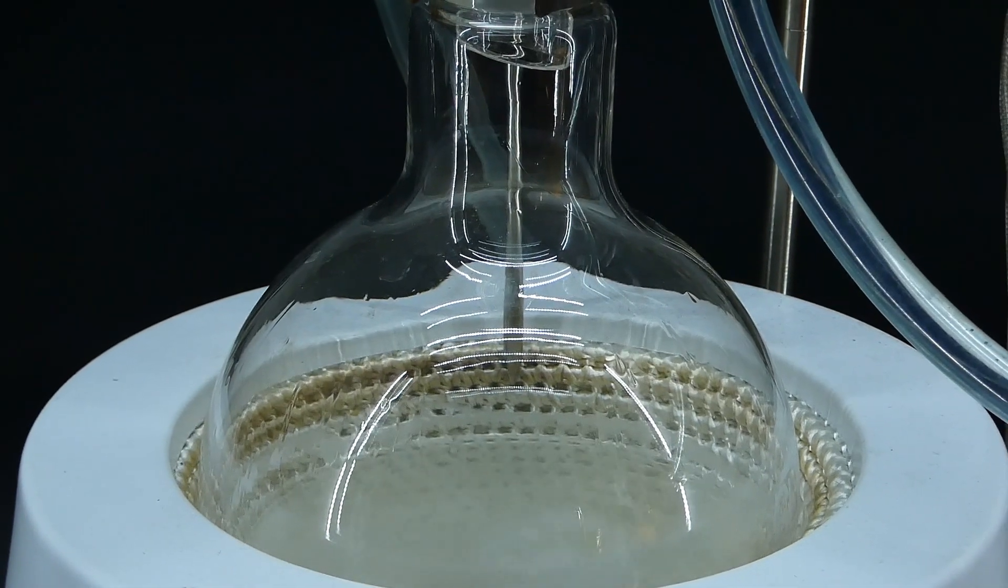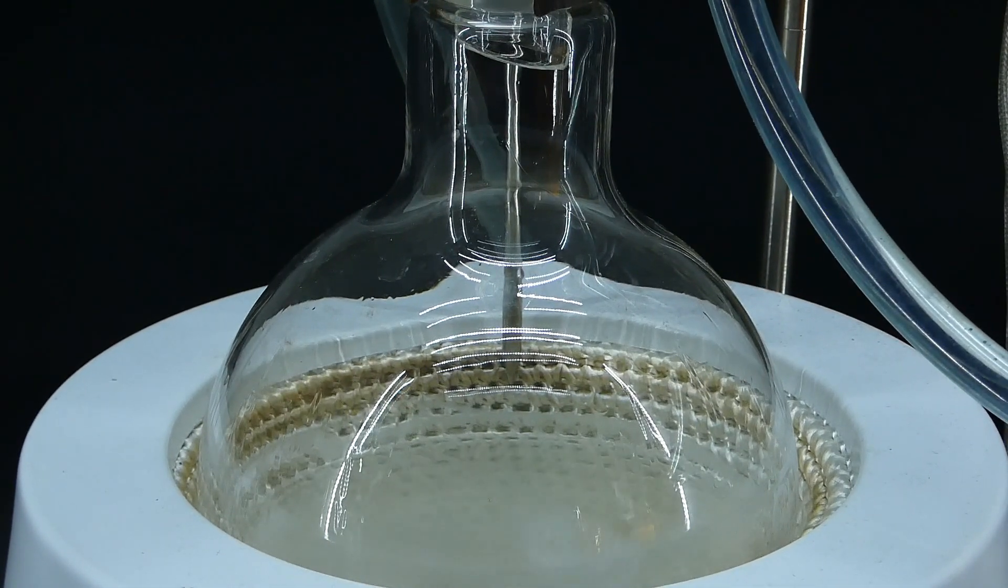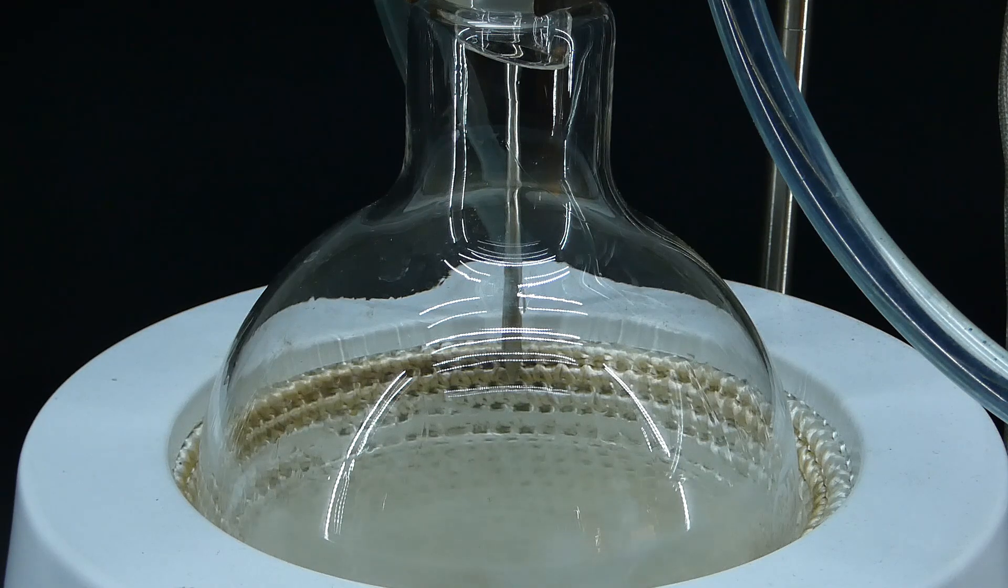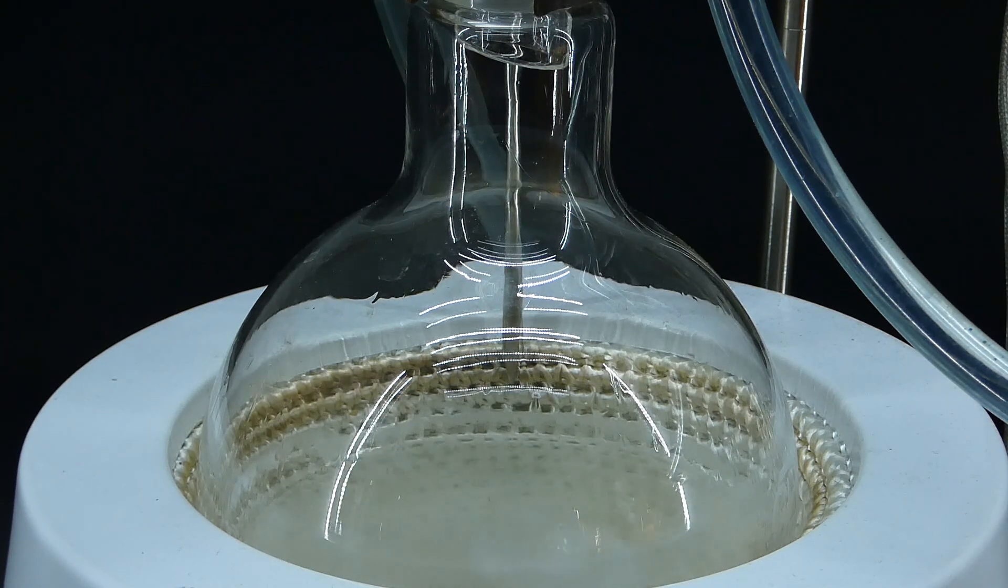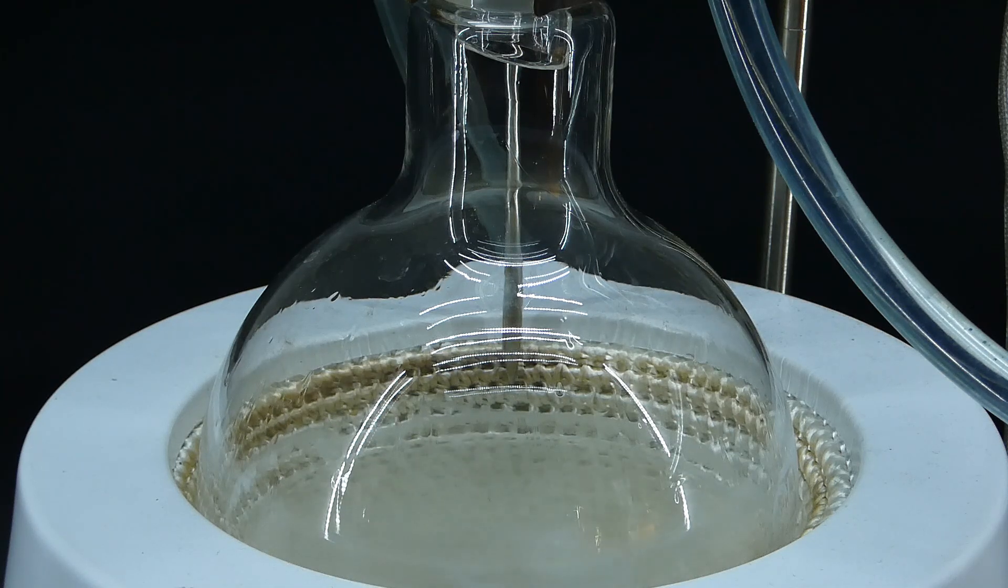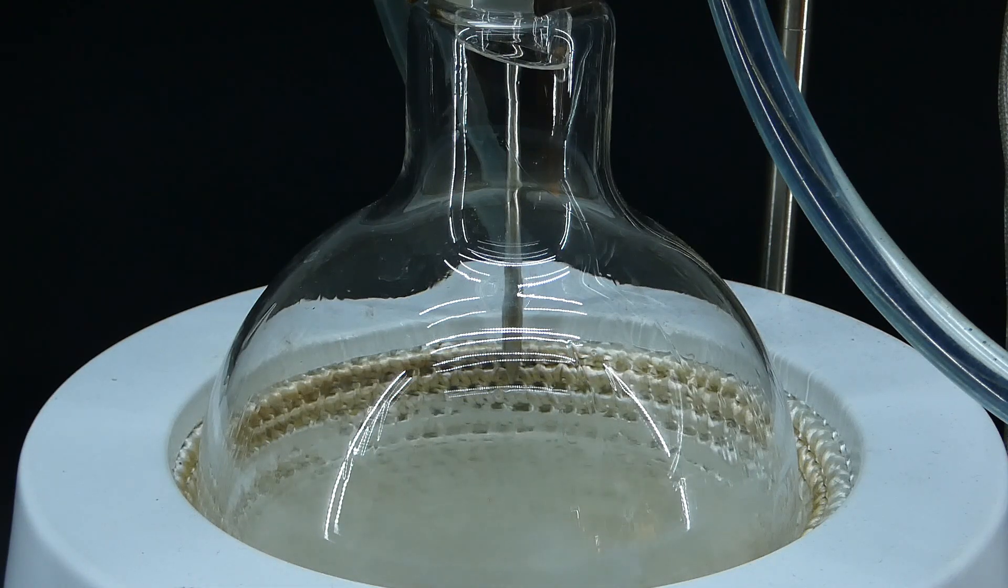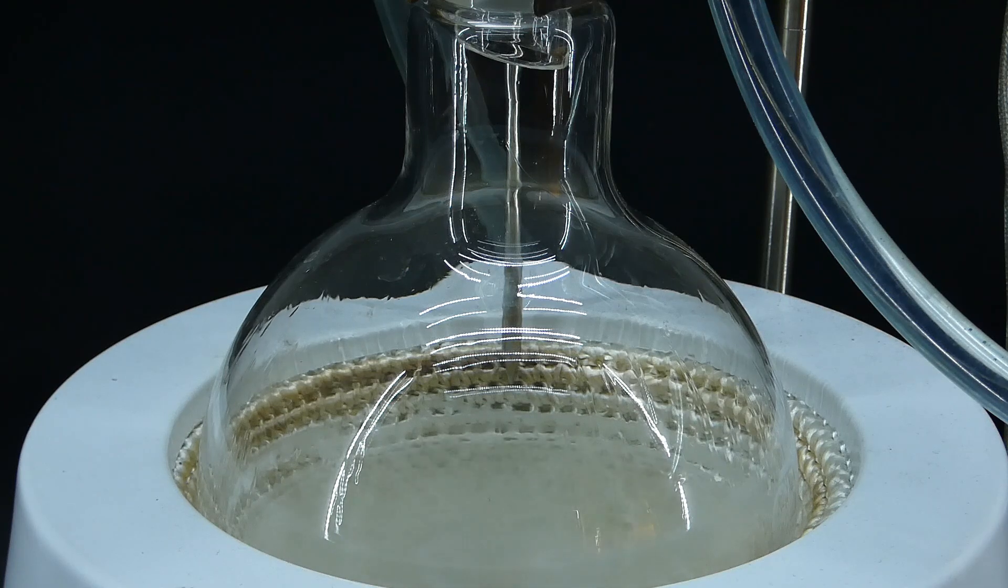What I am doing here is just refluxing the mixture, because the reaction takes some time to complete and requires elevated temperatures at which the methanol boils, so it needs to be condensed to avoid loss. Some of it escapes nonetheless, and that is why I added more. So now that this is refluxing, let's talk about what is going on in there.